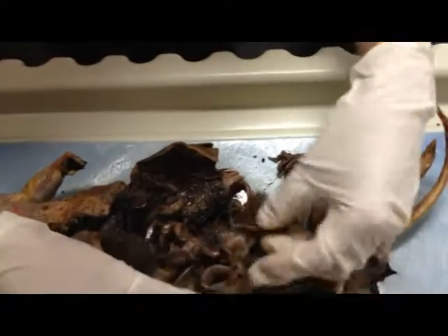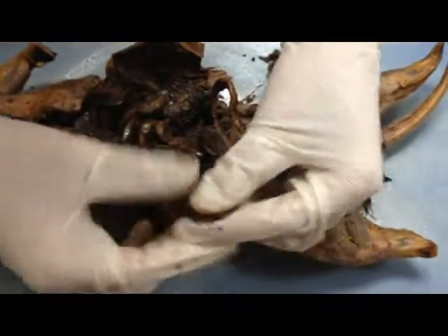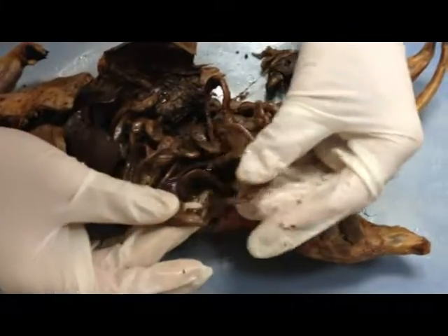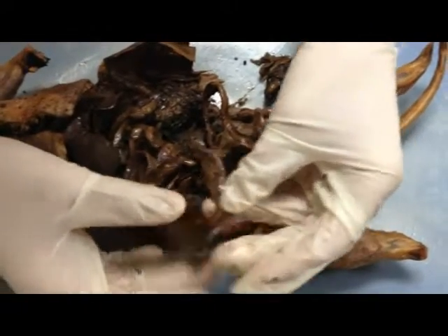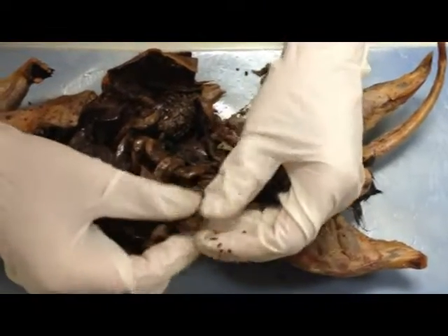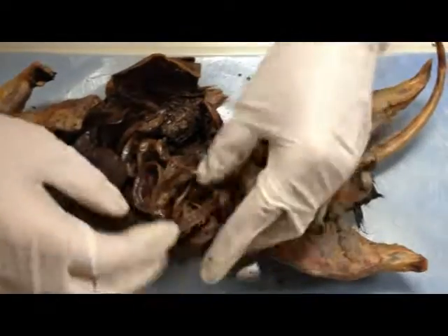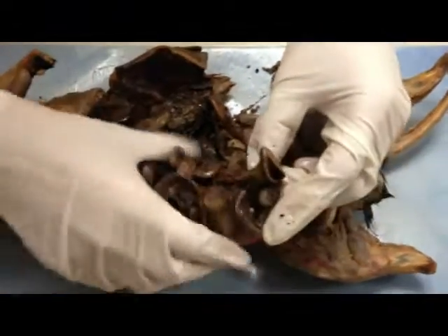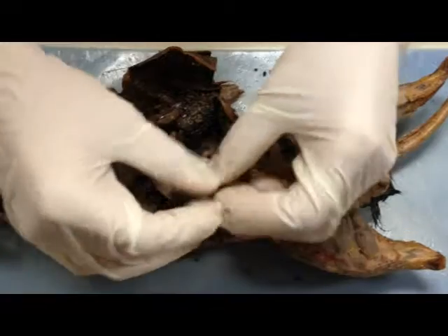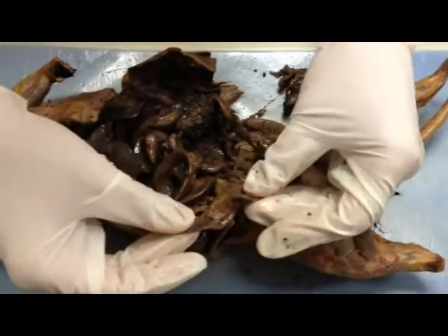Now here it's going to get flat. This flat portion right here would be the large intestines. When it's flat and you have all of this intestine right next to it, you know this is going to be the large intestines because it's flat.